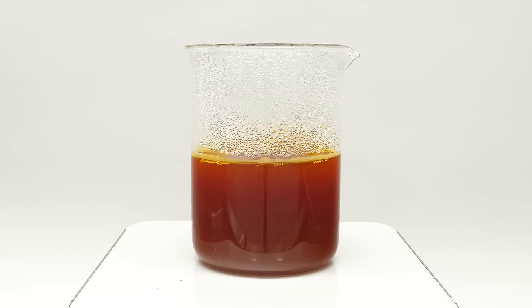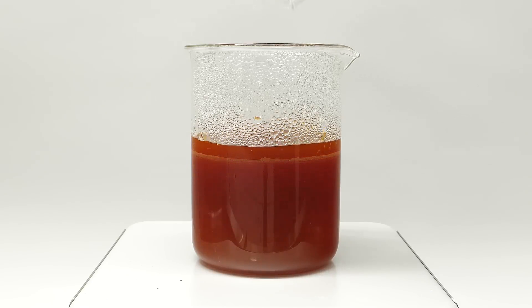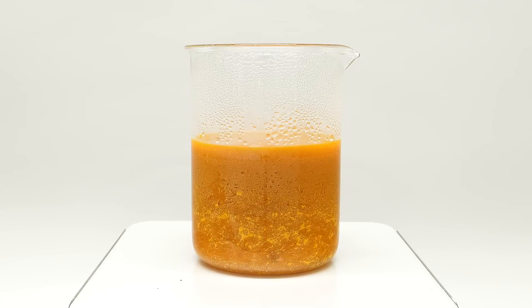This ended up taking about 40 minutes, and now it's finally time to make the bouncy ball. To do this, I just need to add something called 1,2-dichloroethane. It again didn't look like much was happening, but then the color quickly changed, and I started seeing some solid stuff. This was all something called thiokol rubber, and now I basically just had to wait.